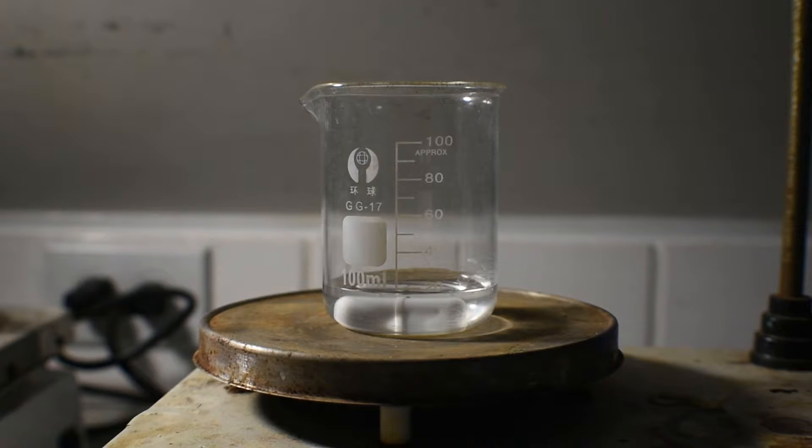I should note that I'm not going to add all of it. After I add the anhydrous ethylenediamine, I'm going to wash out the graduated cylinder with the remaining 5 milliliters of distilled water. This is to prevent any mechanical loss. Now I'm going to add the anhydrous ethylenediamine.